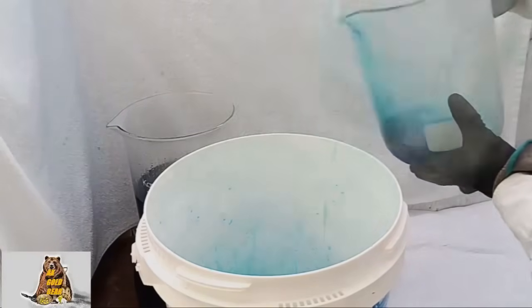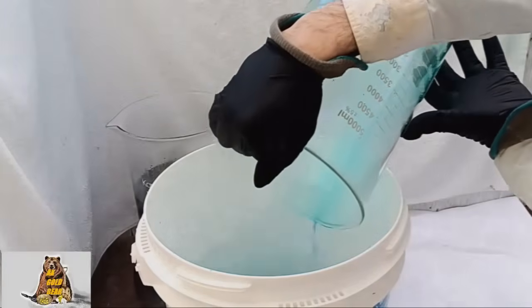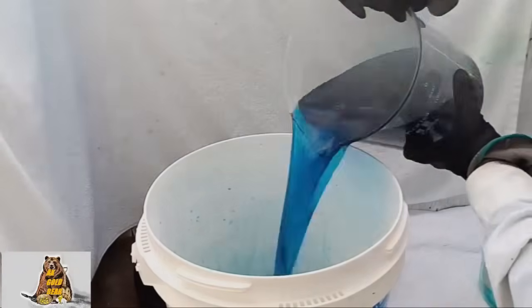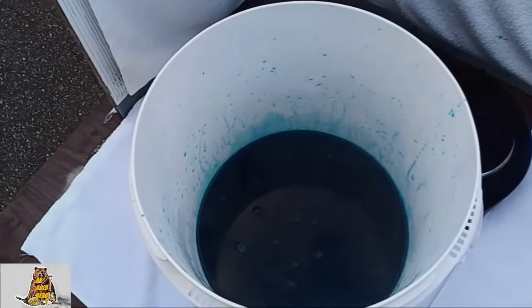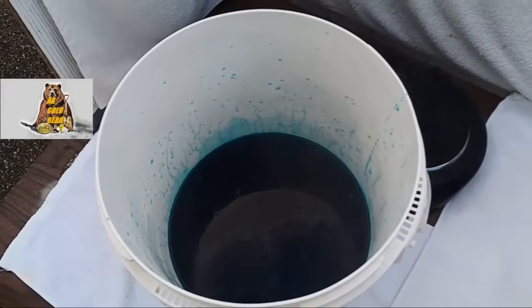I can already see some copper sulfate, even in the hot solution. I will leave the solution overnight. Tomorrow there should be a lot of copper sulfate crystals. See you tomorrow!